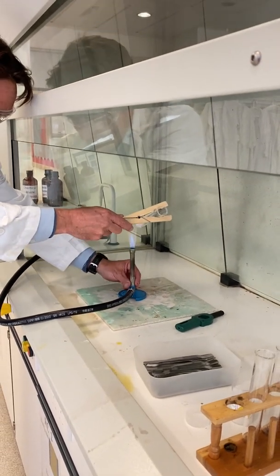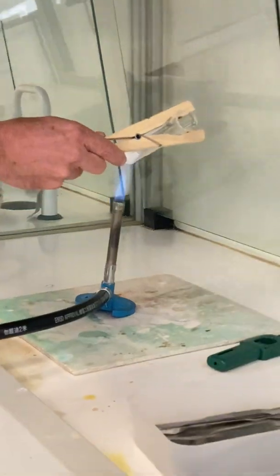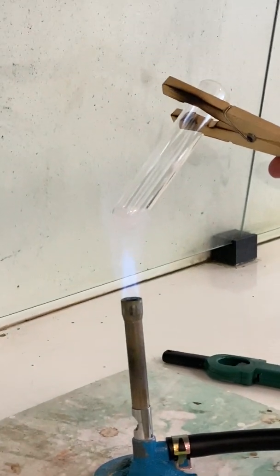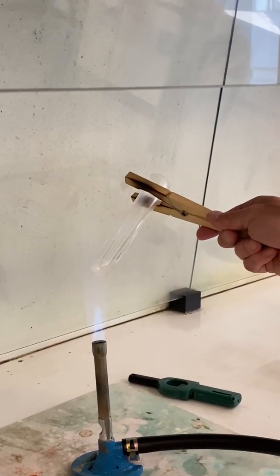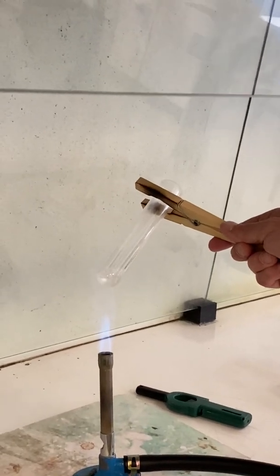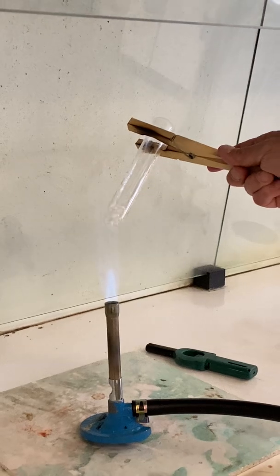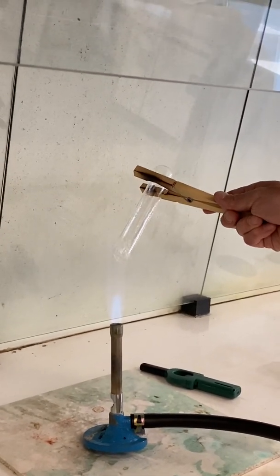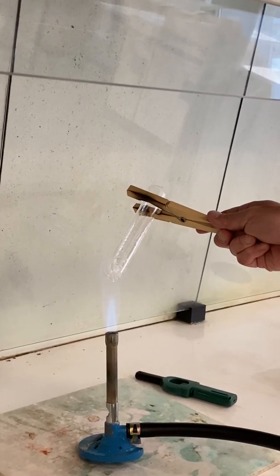So this is magnesium nitrate — we're just heating it hard. You're going to see some water coming off here. This is because this is the crystallized version. A lot of ionic compounds have waters of crystallization, nitrates especially. So what you're seeing here is a lot of water — we're just driving that off. A lot of these have six waters of crystallization.